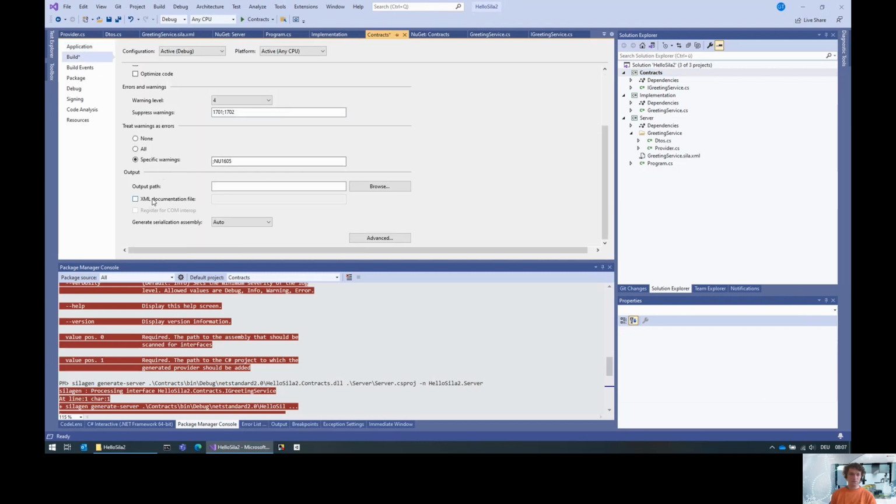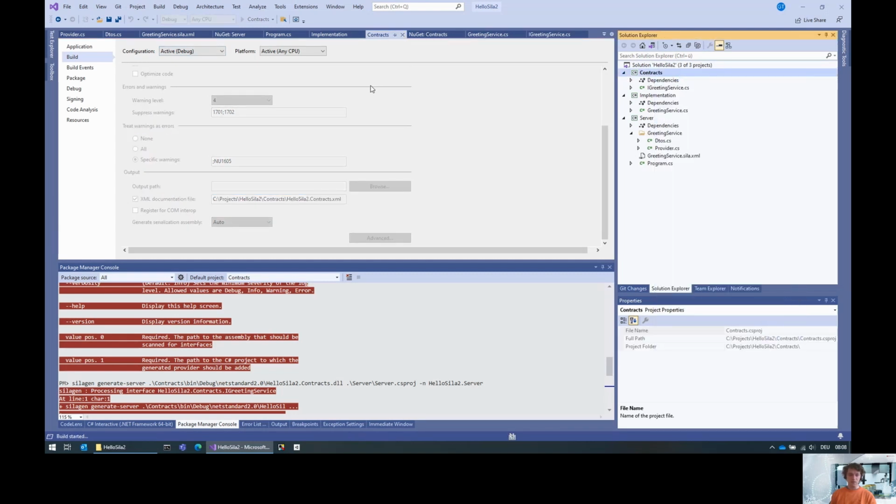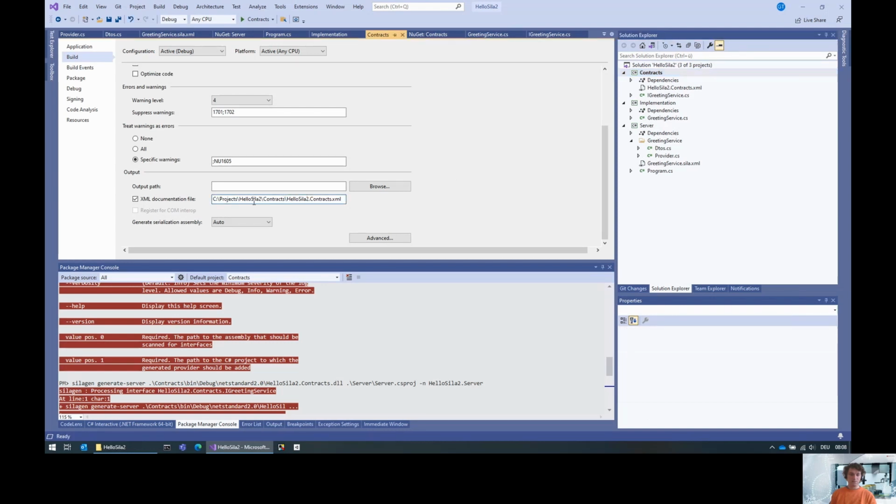So number one is to generate the XML documentation. Otherwise, it's not possible to read the documentation because it's just not there. So then we recompile to get the documentation actually generated for us. Yeah, that succeeded. And then the other problem is that this documentation file and the assembly have to be in the same folder.